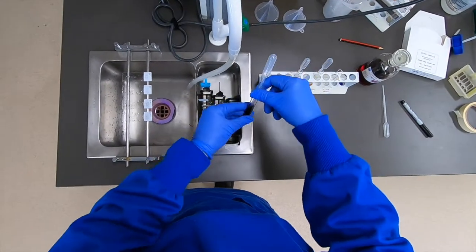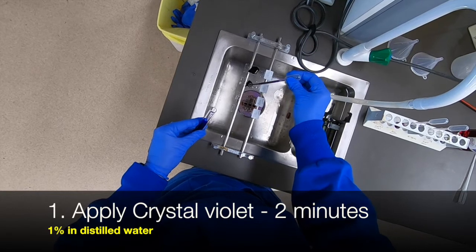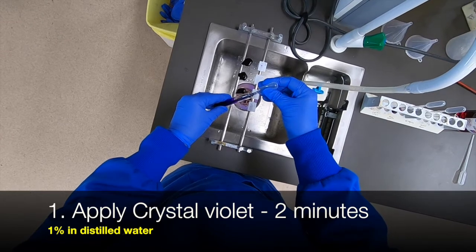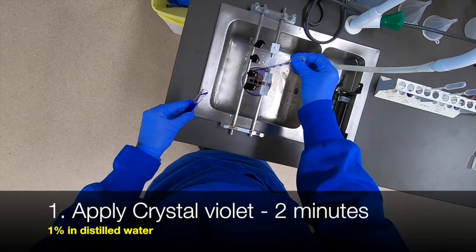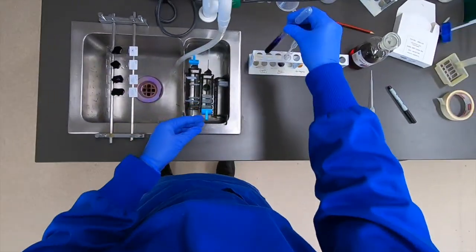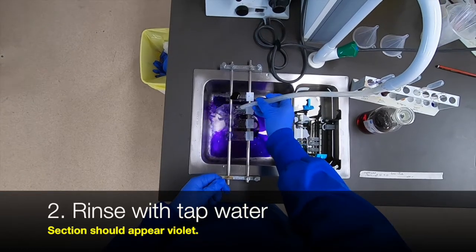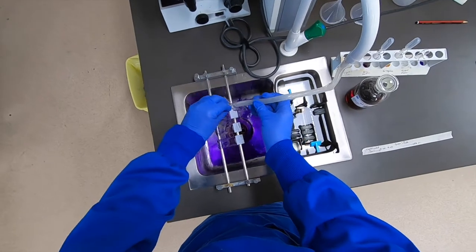Here we have four sections which are control sections containing a mixture of positive and negative organisms. The first step for all these slides — two for Brown-Hopps and two for the Twort method — is simply to apply the crystal violet solution for two minutes. At the end of two minutes we simply rinse off the crystal violet from the slides. If we pick one up and look at it more closely, we can see at this point quite a very bright violet colour.